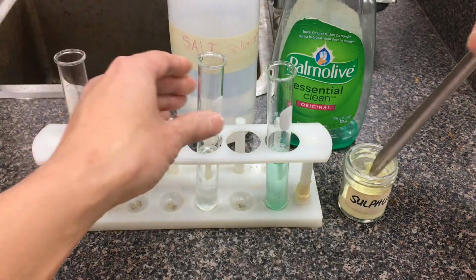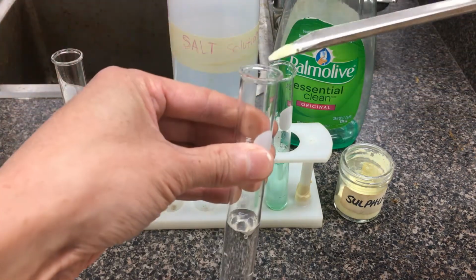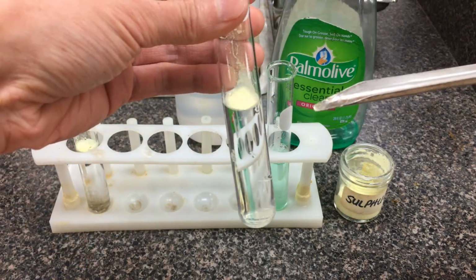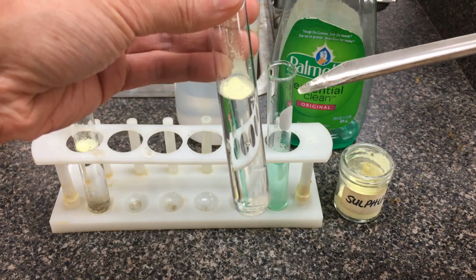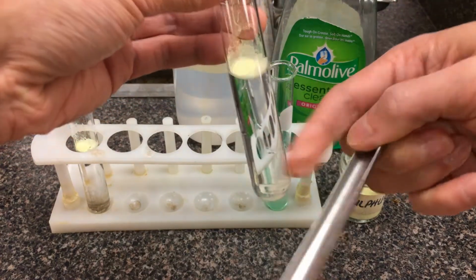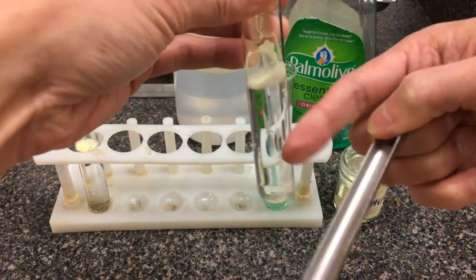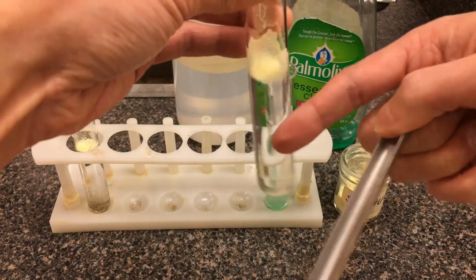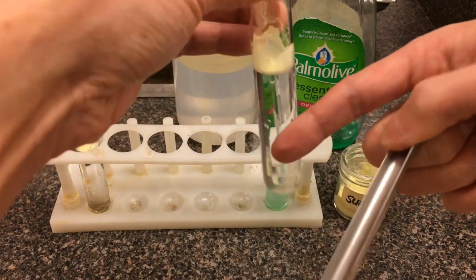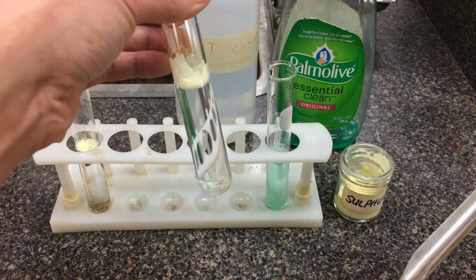We do the same with the saltwater solution here. So we just dissolved a lot of table salt into this water. Again, sulfur powder. Seems like there's good enough surface tension here on the top. Give it a tap and give it a swirl. Basically, we're giving it a chance, if the sulfur is more dense, to fall through, and we'd be able to notice that effect. So pretty good. Holds together there.